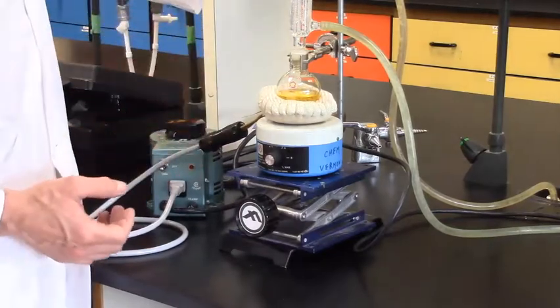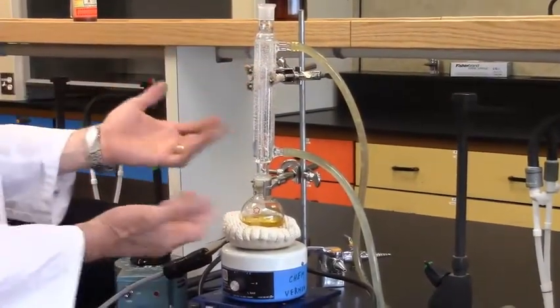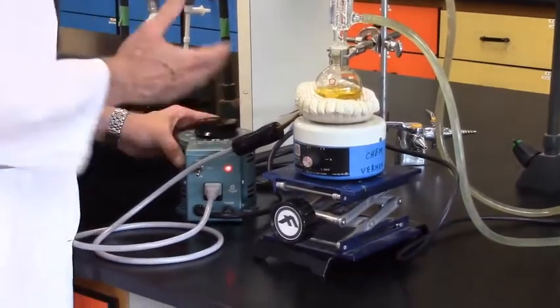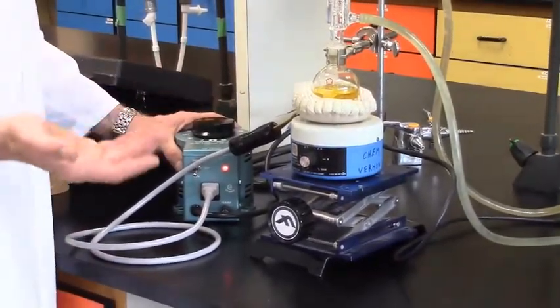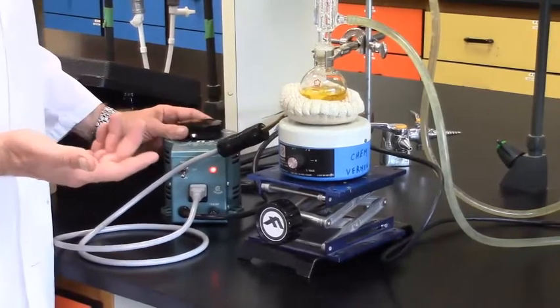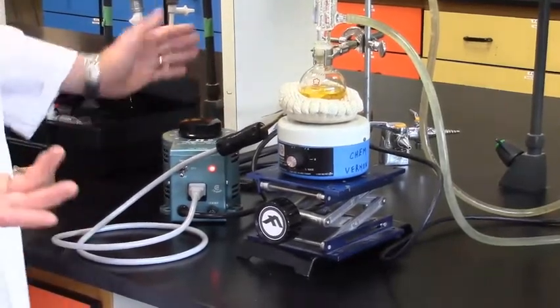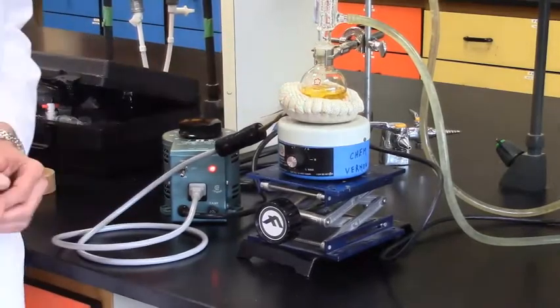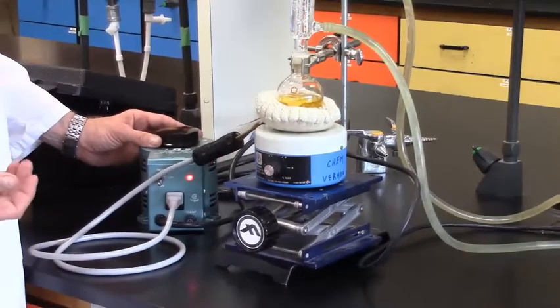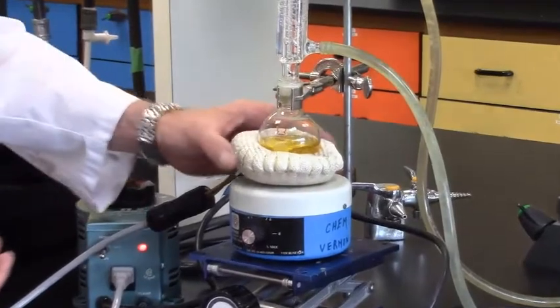My system is ready to go. The cooling water is still flowing through the condenser. It's clamped properly, it's stirring, and it's open to the environment. I'll turn it on. Knowing this is a low boiling solvent at 36 to 37 degrees, I'm not going to heat aggressively — it won't take a lot of energy to boil the solution. I'm going to set it to 50, halfway, and watch it closely. Once reflux starts, I may have to adjust downward. For higher boiling point solvents you'd adjust up, but in this instance 40 to 50 should be adequate.